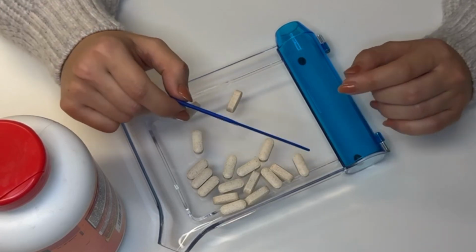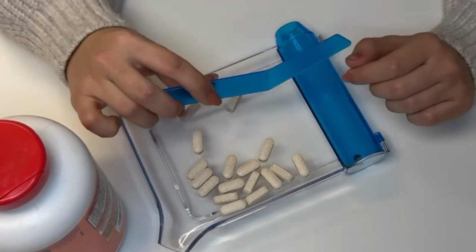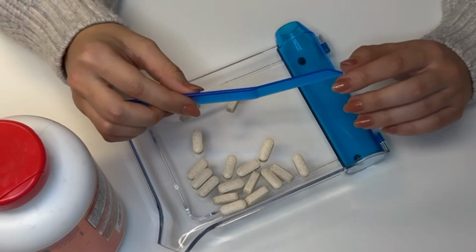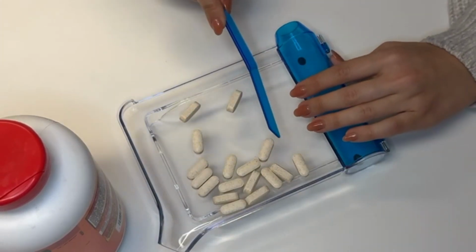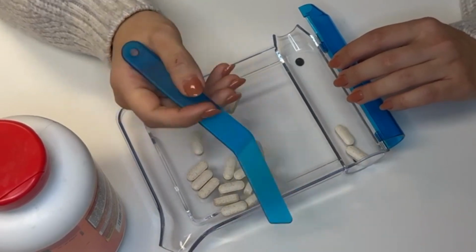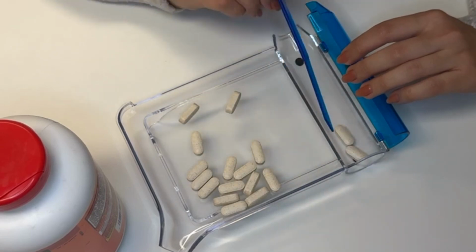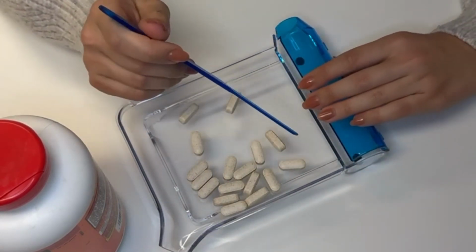And at the end, always do one quick check. Move any extra pills back to the main area and confirm the final number. What do I mean? For example, you counted like this, 2 tablets. You're not sure about the number of tablets that you counted, right? So with the help of your spatula, take it back to the main surface and recount it.